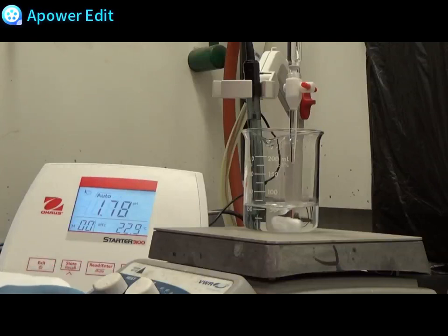From the beginning we started at 1.39 and after adding 5 milliliters of 0.5 molar sodium hydroxide we have a pH of 1.78 now. I will continue the titration off-camera and then bring you back when we are close to the 10 pH range.